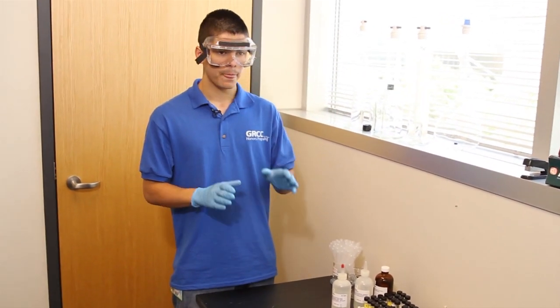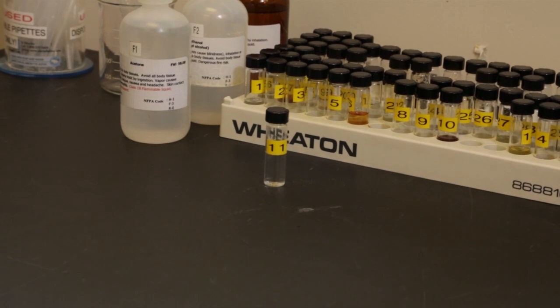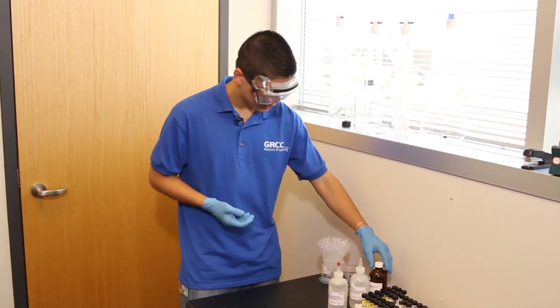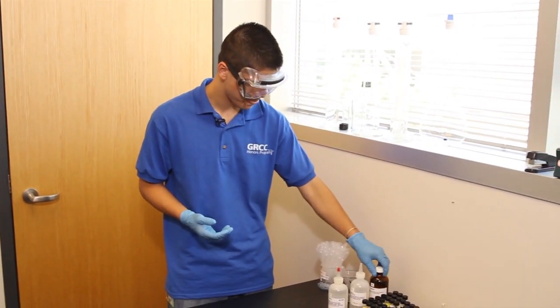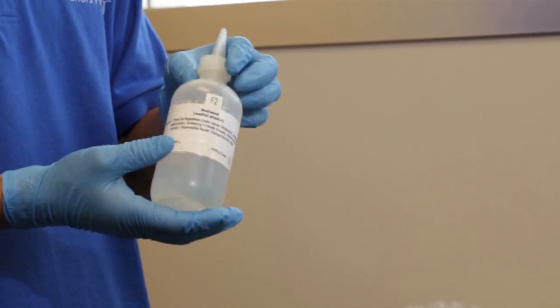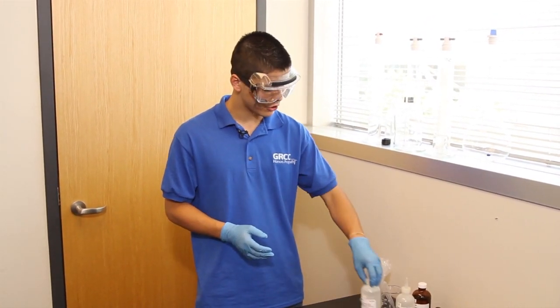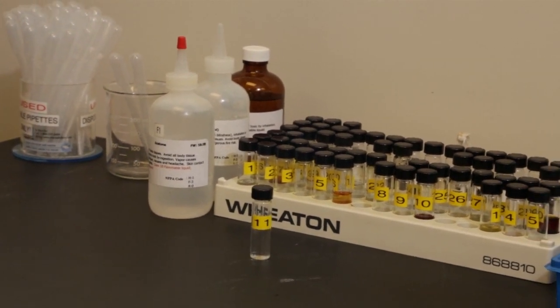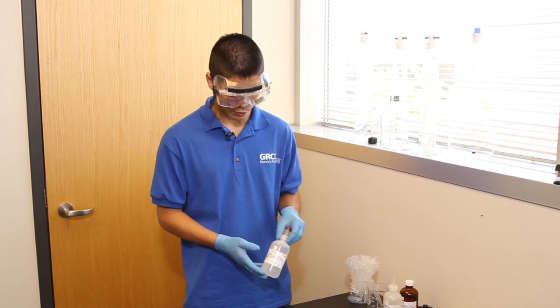The reason for diluting is that the gas chromatography runs the sample through the column to separate out the components. When you have too much sample and it's too concentrated, the GC has a hard time separating it and you don't get very good results. I have a couple of commonly used solvents here: hexane, which is a general one; methanol, which is probably the universal one; and acetone, which is the one I'll be using today. If you know what your sample is, make sure the solvent you use is compatible with it. If you don't know, methanol and acetone are pretty universal. I know acetone works with my sample, so that's what I'll be using.